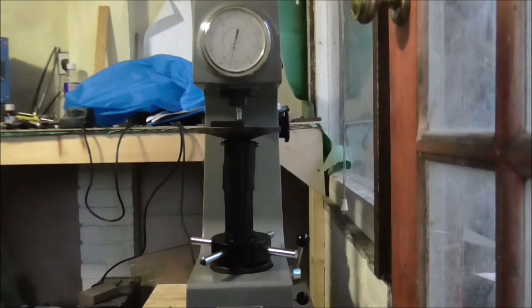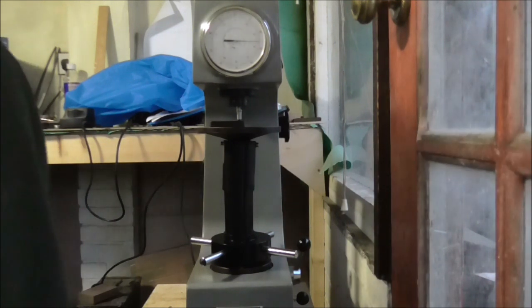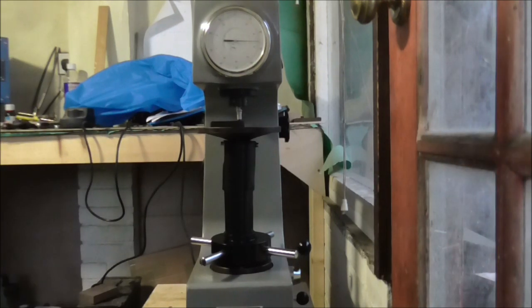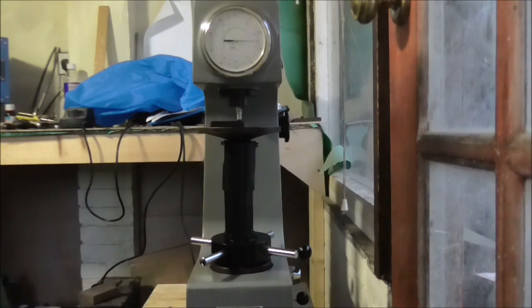A little diamond indenter coming down with a test load. I'll just let that settle. This will tell me where the machine is. If I'm out by a little bit I can allow for that.